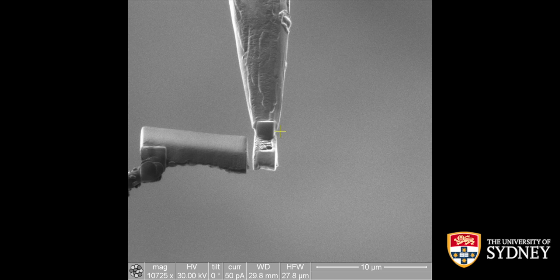Always try to remember what sort of stage command will make your stage move in the right direction, because if you get it wrong, you'll break your assembly. Once again, this is one of the critical points where if you move things the wrong way, things will break. Simple, just try to remember which way you're moving things.